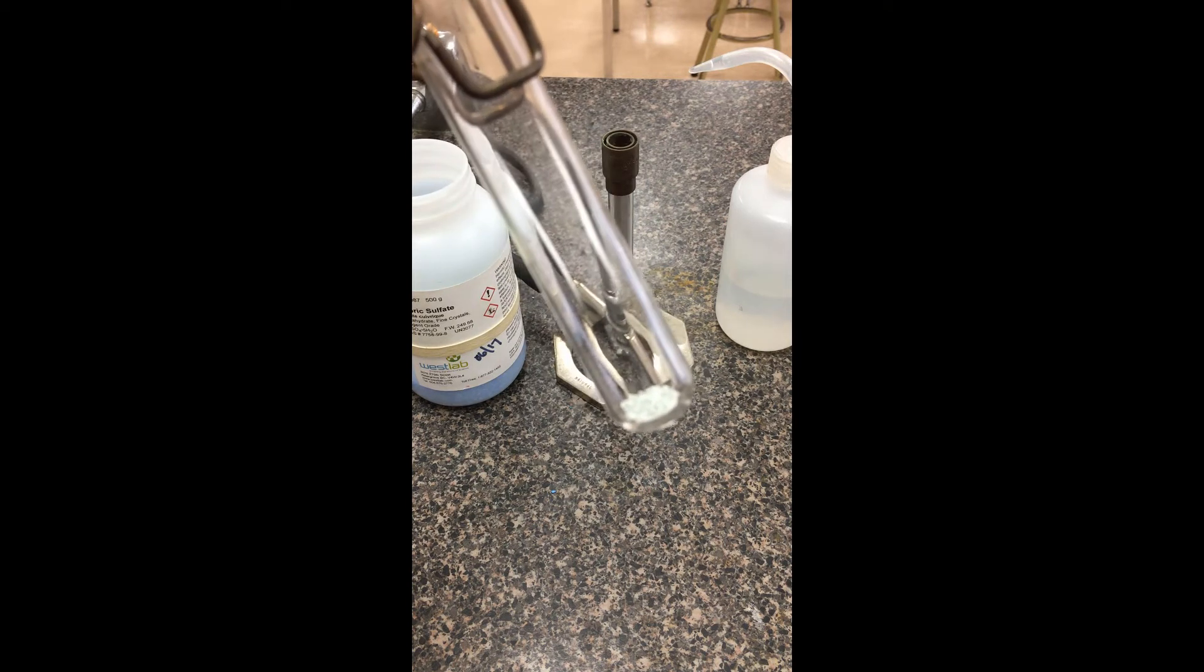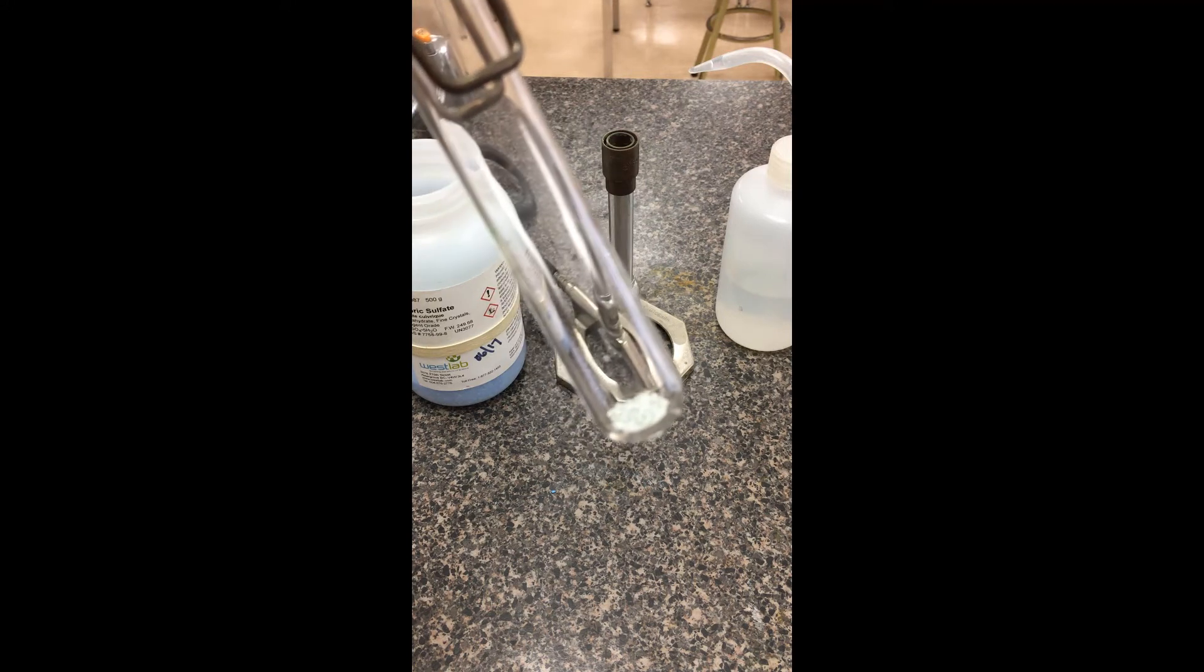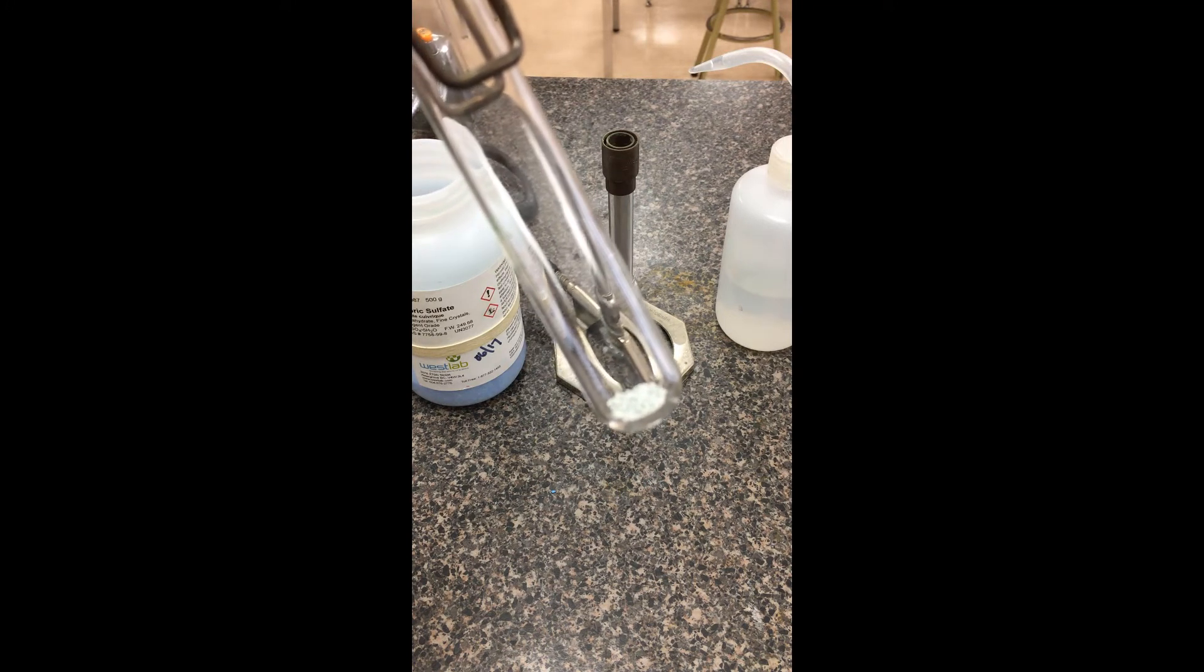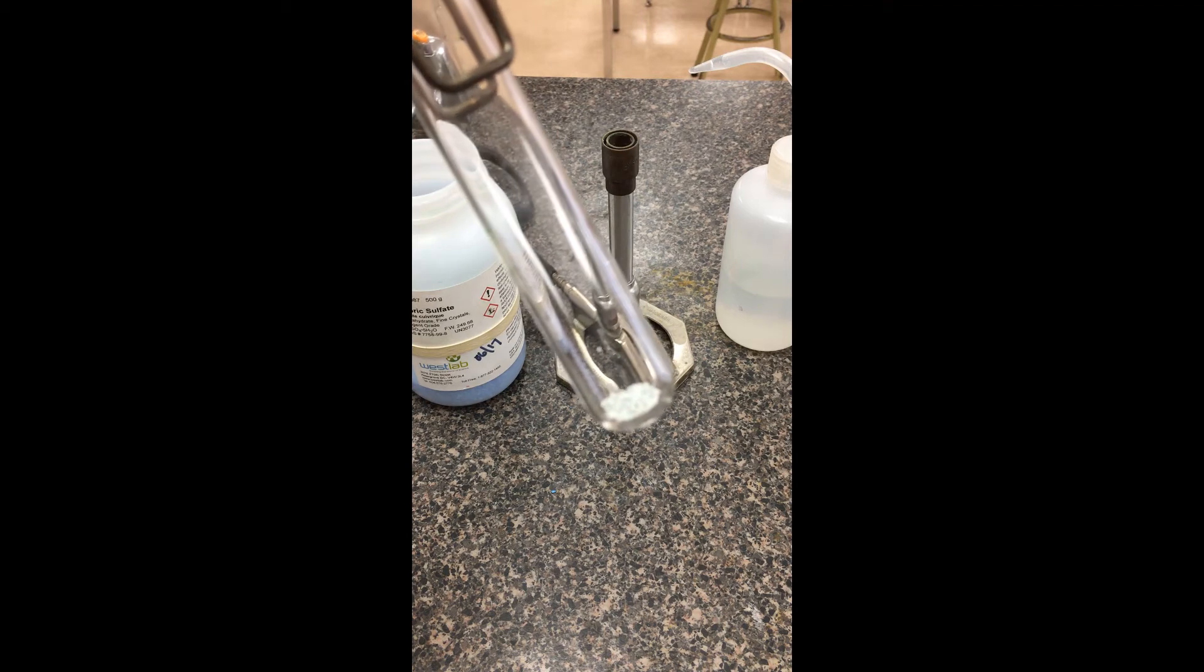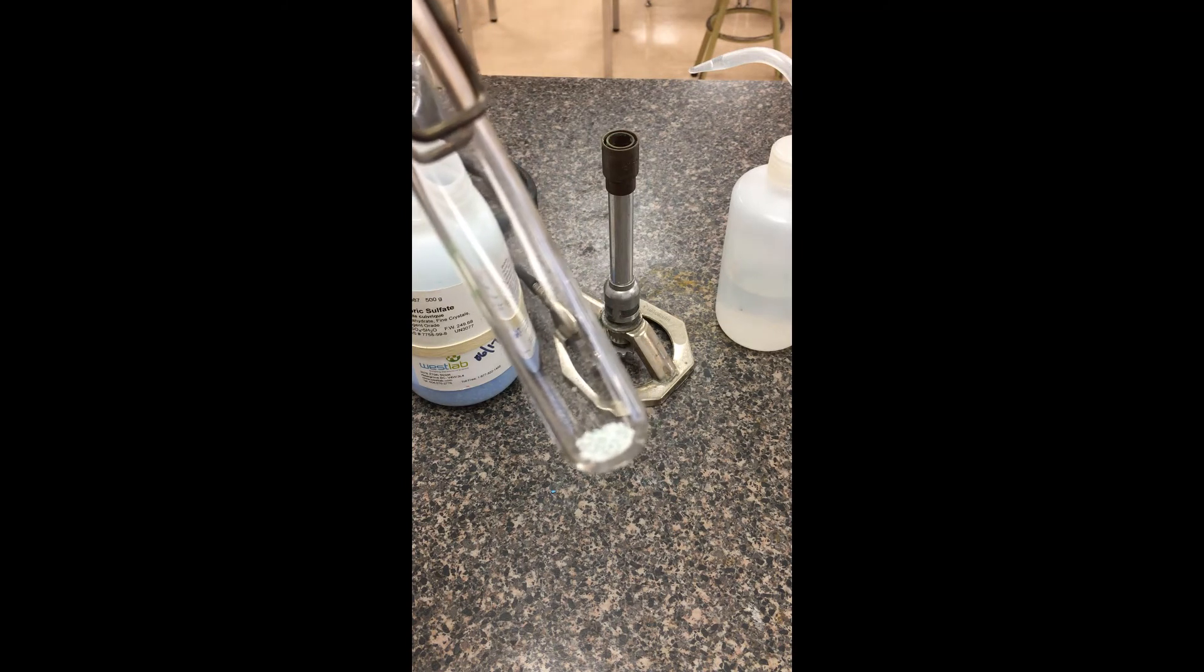So again, just waiting for this to cool down a little bit. You'll notice I'm holding this test tube with the test tube clamp. You don't want to be holding it with your just bare fingers over the Bunsen burner.